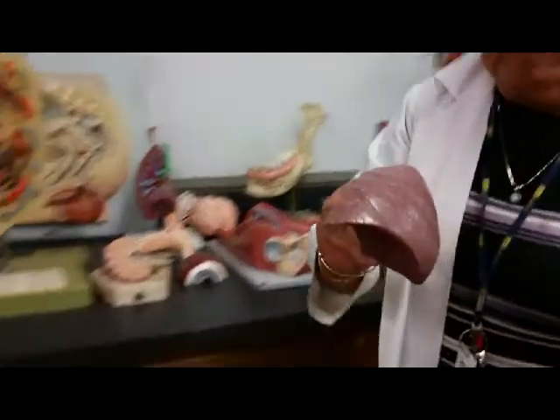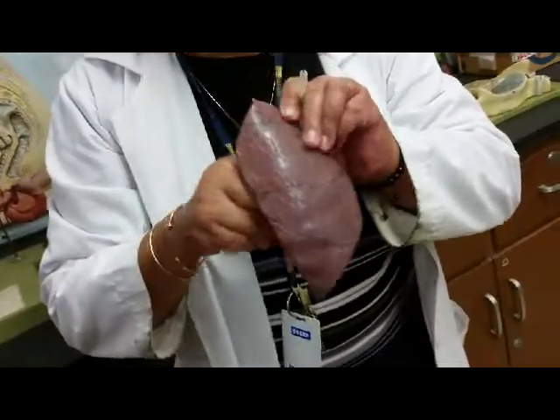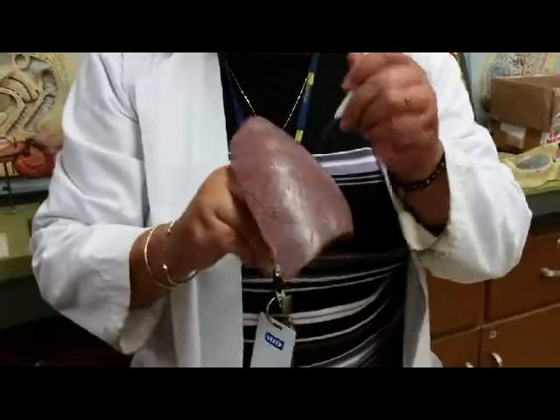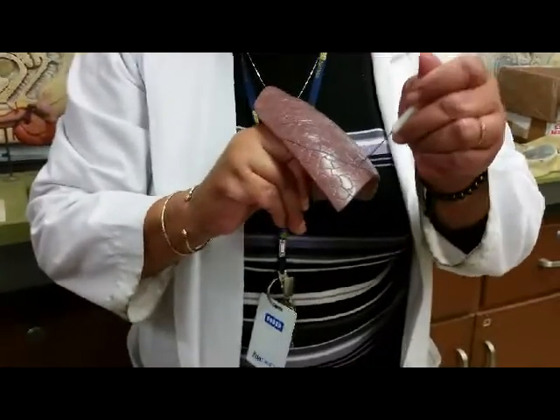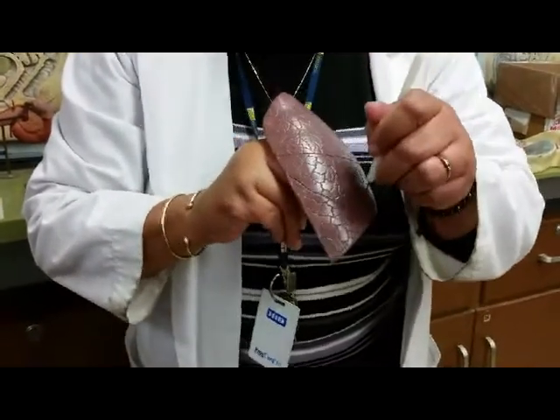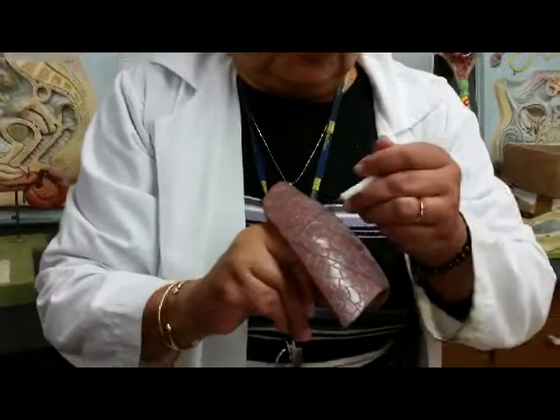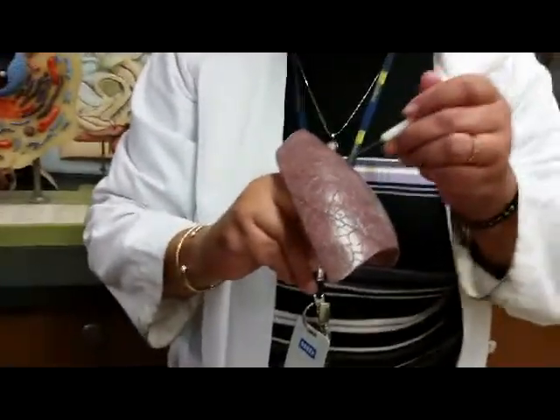Now the right lung: superior, middle, and inferior. So again, be specific. This would be the right superior lobe. This would be the right middle lobe, and this would be the right inferior lobe. This is the right lung that has three lobes, but two fissures. These are the fissures. You had it on test number 4. Three lobes, but two fissures. The lines are called the fissures.